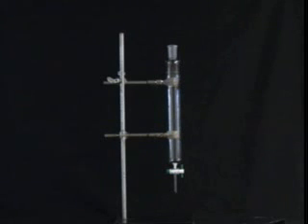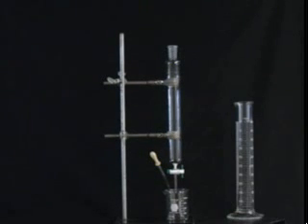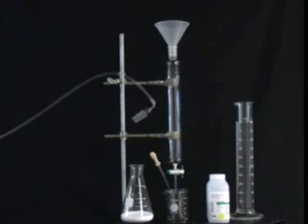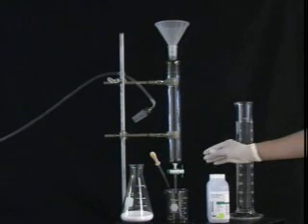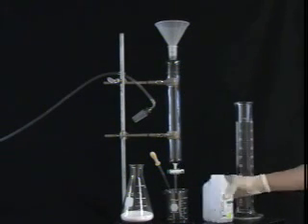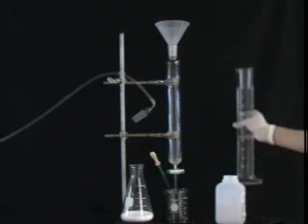To continue packing the column, you will need an empty beaker, a pipette, a supply of your chosen solvent mixture, a funnel, your pre-weighed silica gel, some sand, and a flash pressure apparatus. With the cotton in place, clamp the column in a straight vertical position, and use a funnel to pour in a small layer of sand, approximately 1 to 2 millimeters.